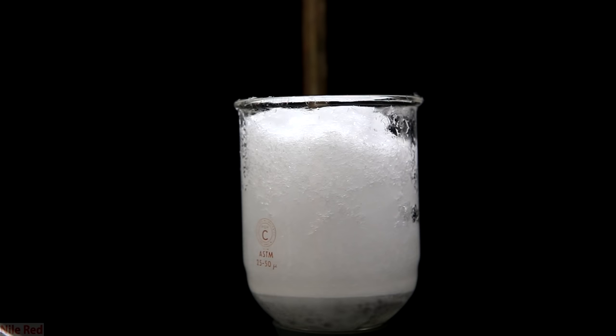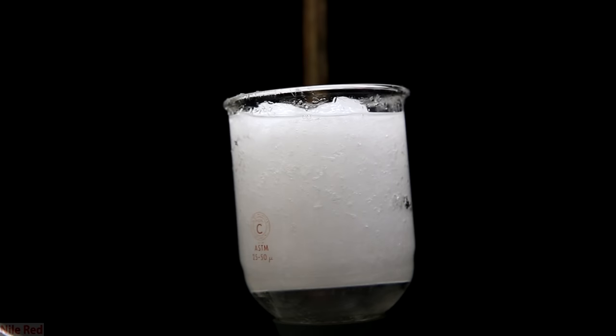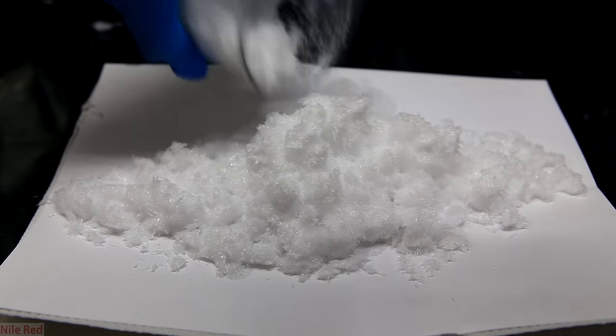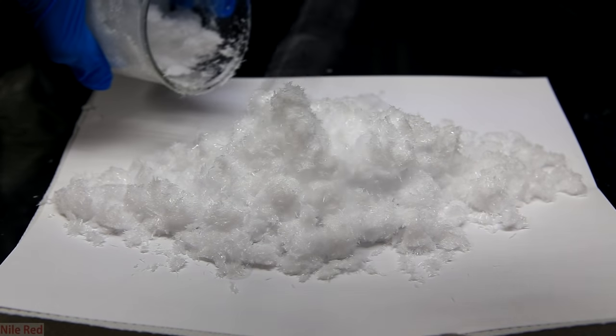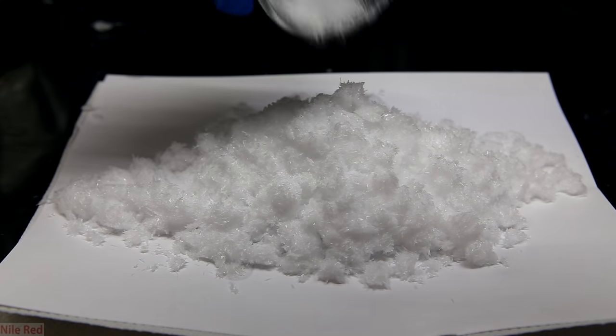The only difference in this part is that I had to wash the beaker a few times to get out any crystals that might remain and add this to the filter as well. After drying it under vacuum for a few minutes, I add it to the batch we had before. After adding it to this, we're left with a large batch of crystals which are slightly wet with ethanol.